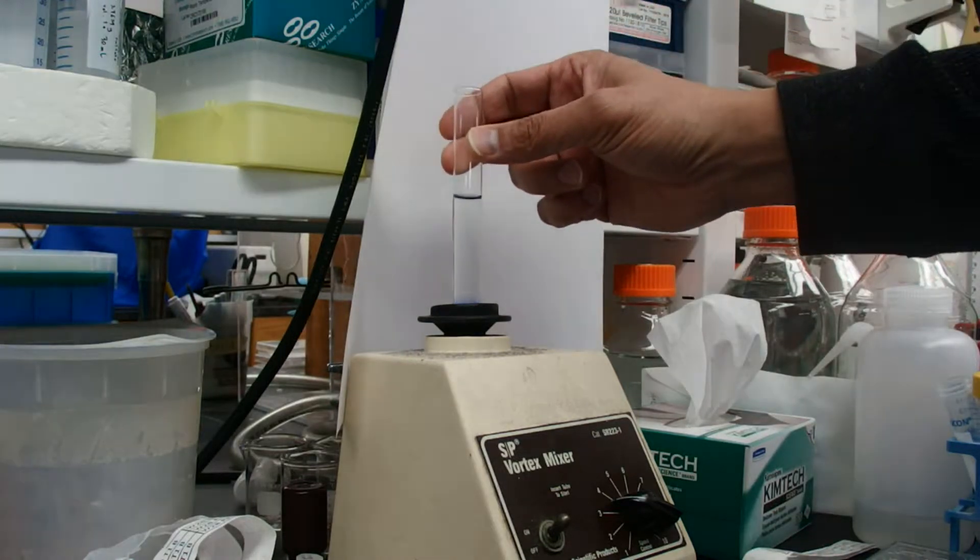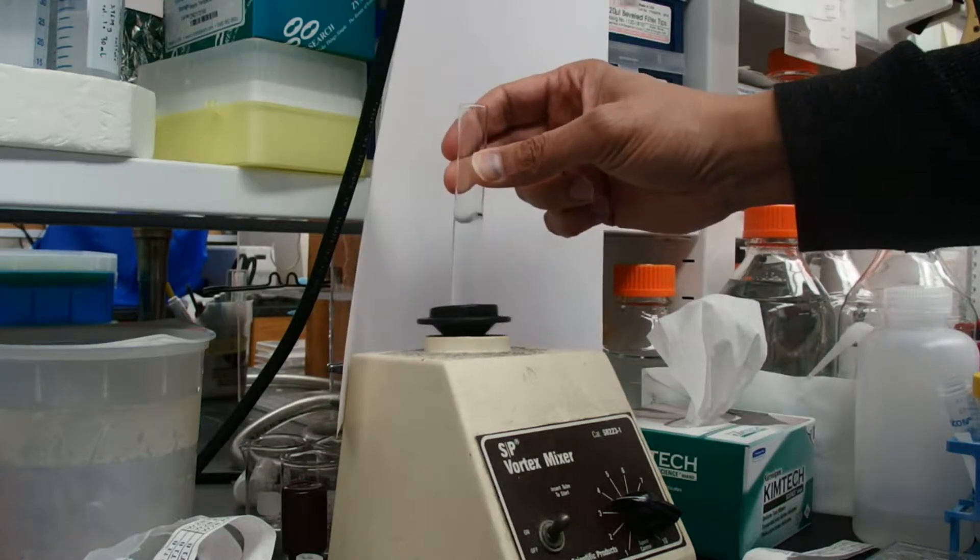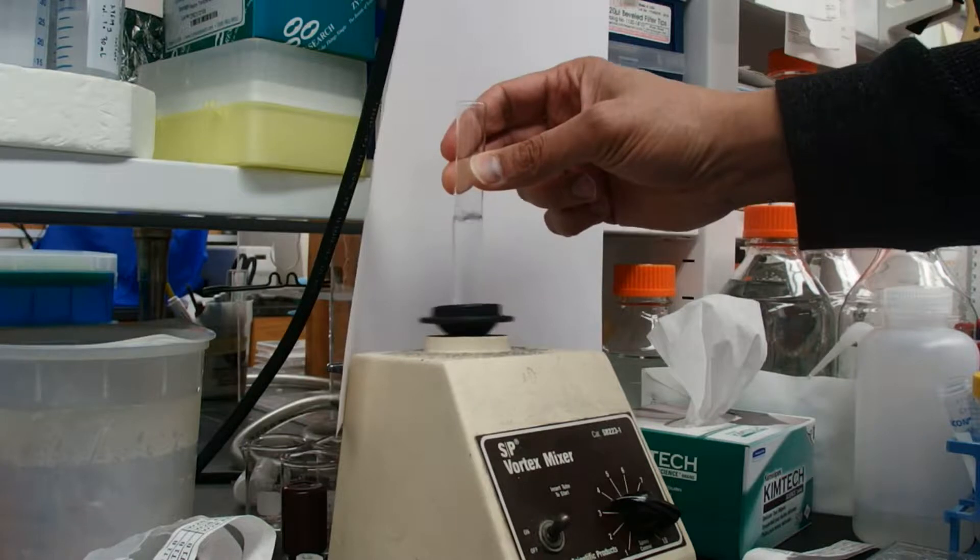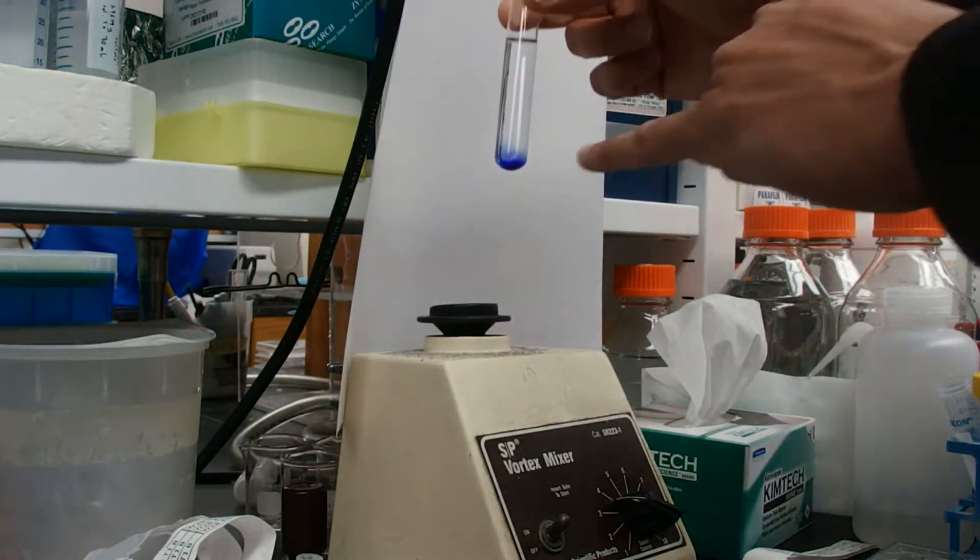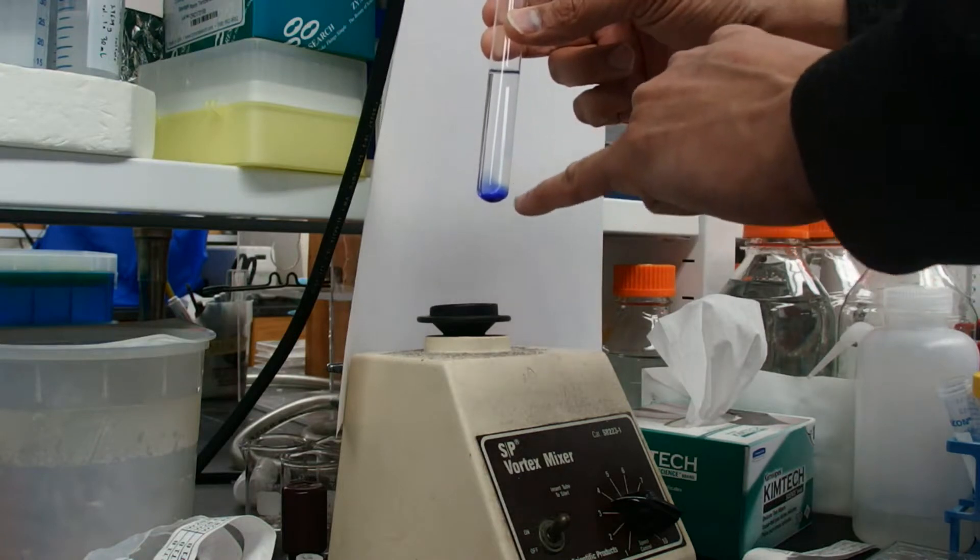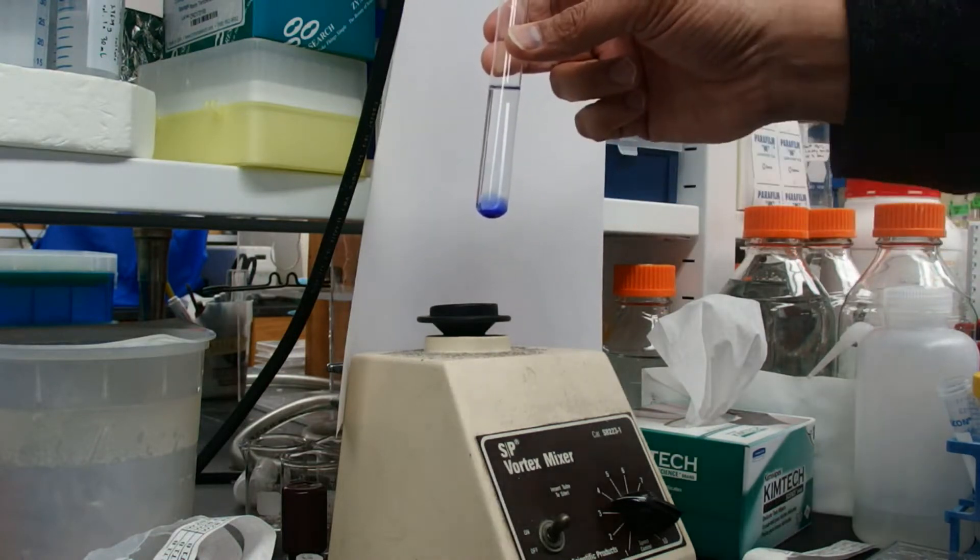If you vortex too gently, so that stuff just shakes on top—as you can see here, what I'm doing—stuff is shaking on the top, but I have not mixed any of that blue dye into the rest of the water.